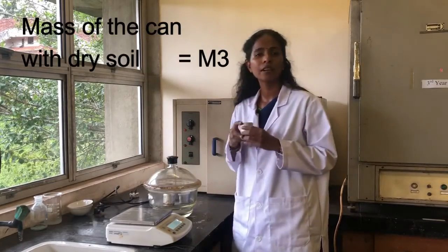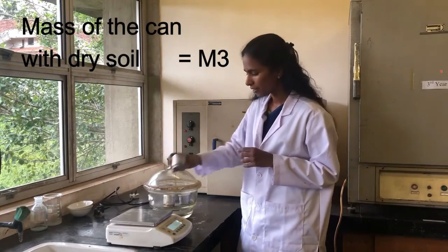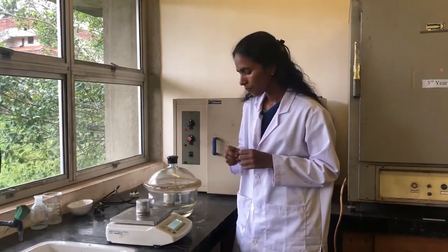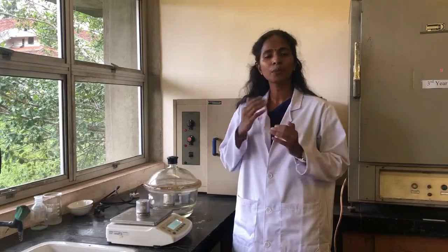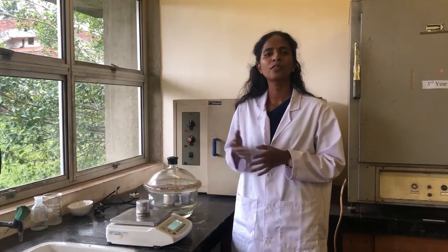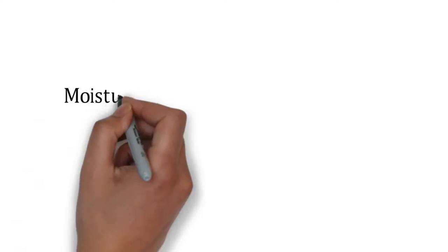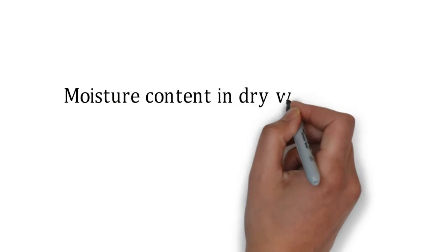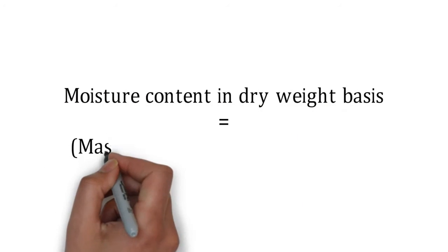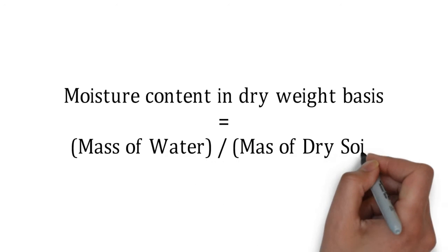Finally, we measure the dry weight of the sample using the balance. We repeat this process several times until a constant weight is obtained. Generally, the moisture content on a dry weight basis is the ratio of the mass of water to the mass of dry soil.